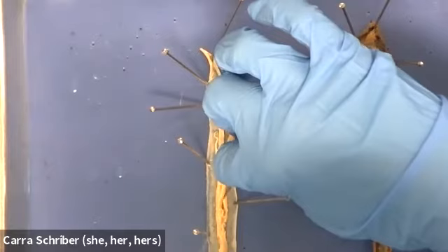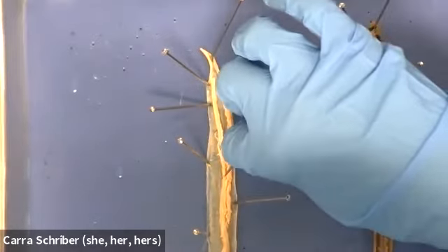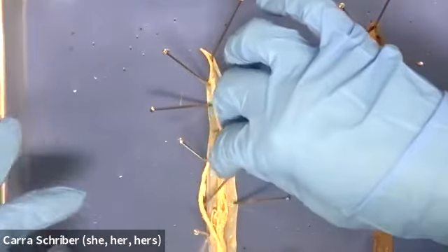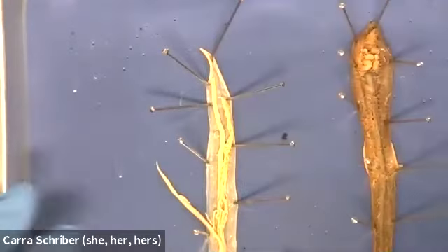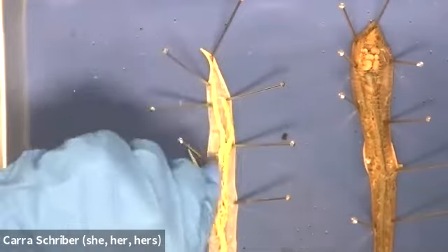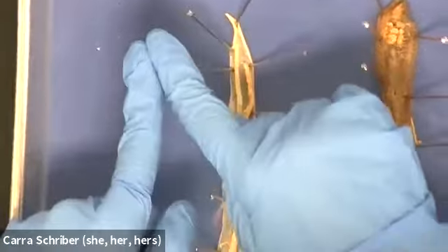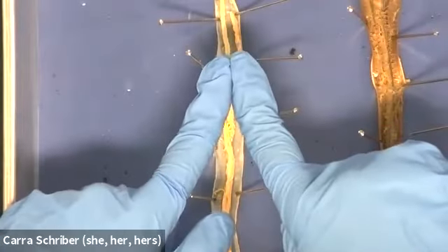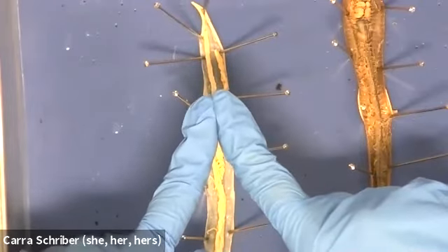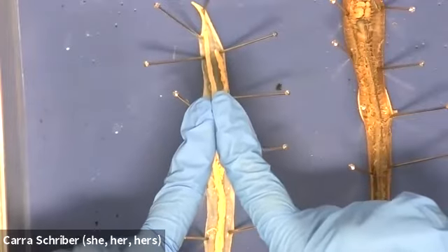There is one piece that is all coiled, so it's hard to separate out, but there's some tubing here. I think you can see this. I'll take that out. This is a thick tubing, and it's going to be placed like this. About an inch or so below the mouth on the organism, this tubing is going to start connected like this, and then the tubes are going to separate away from each other.